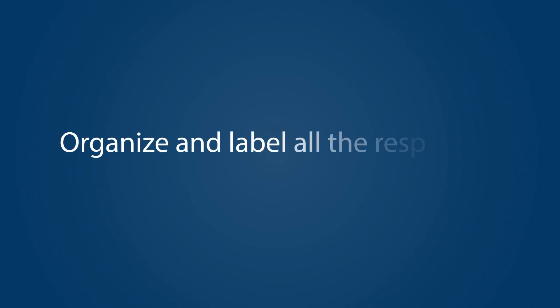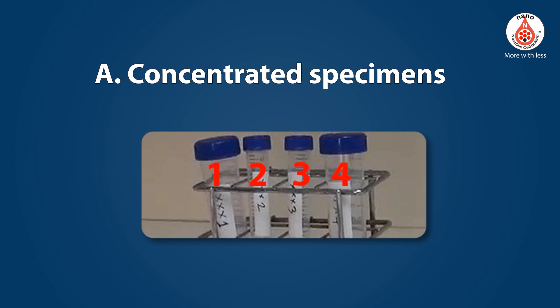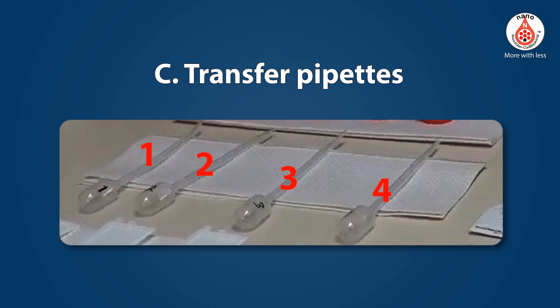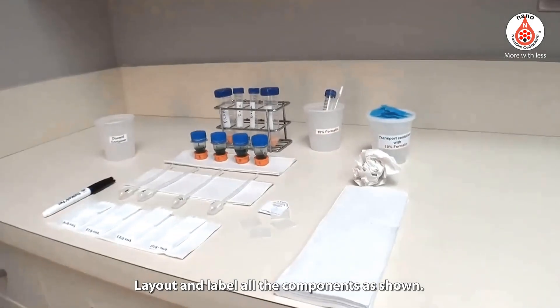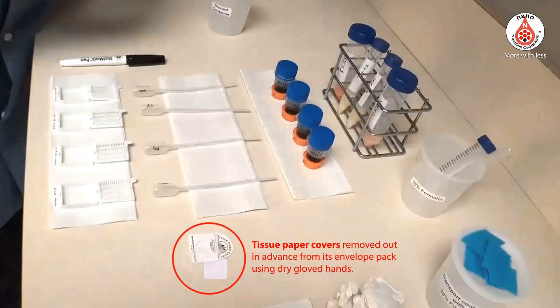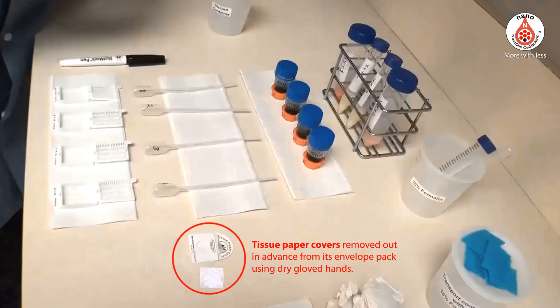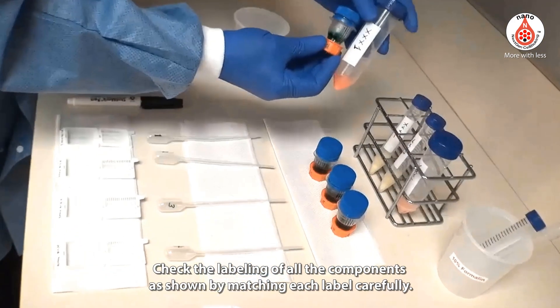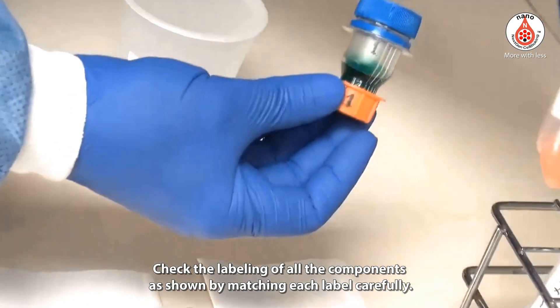Organize and label all the respective components, which include: concentrated specimens, Nano Next Gen Cell Blocking Units, transfer pipettes, and tissue cassettes. Layout and label all the components as shown. Tissue paper covers should be removed in advance from their envelope pack using dry gloved hands. Check the labeling of all the components as shown by matching each label carefully.